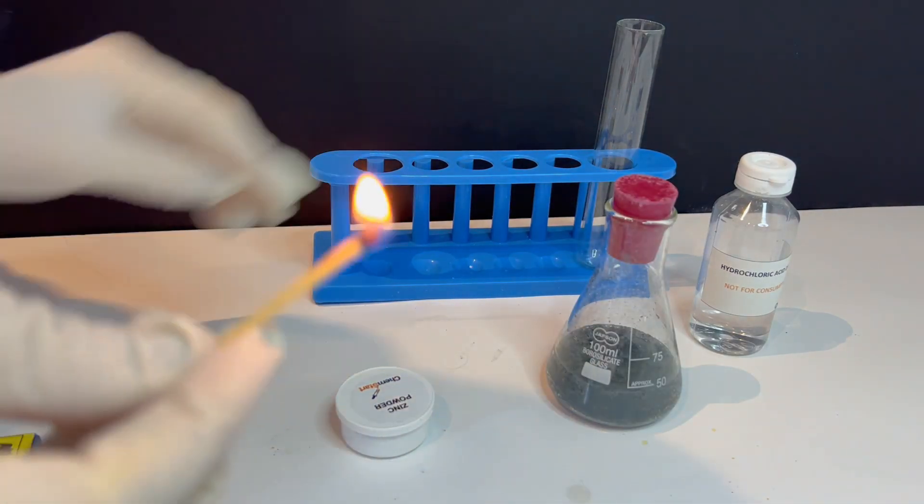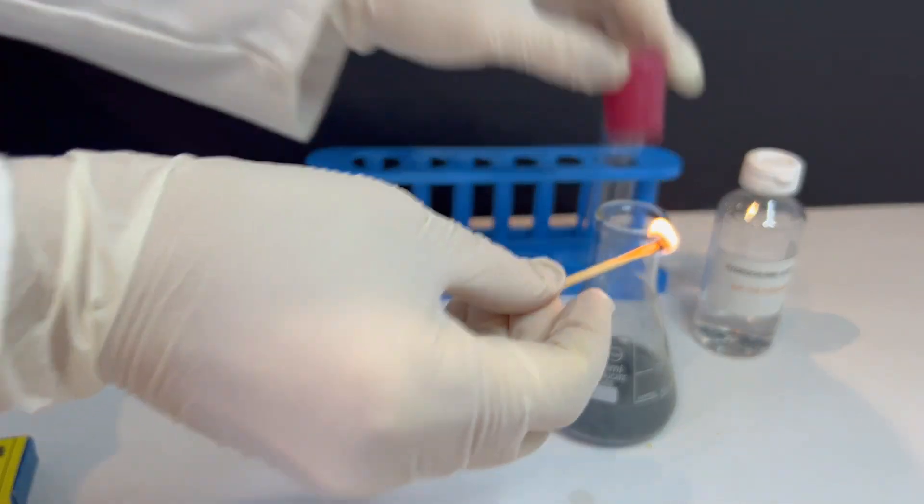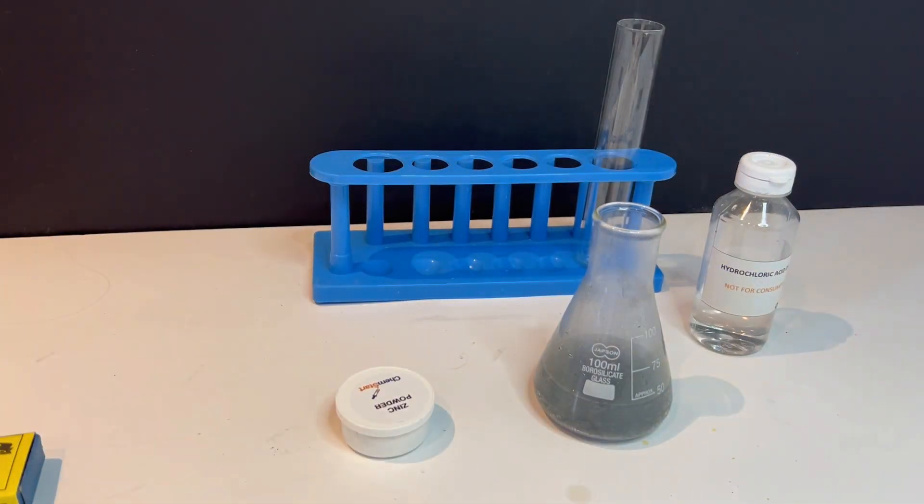That popping sound confirms that the gas is hydrogen. This is called the hydrogen pop test.